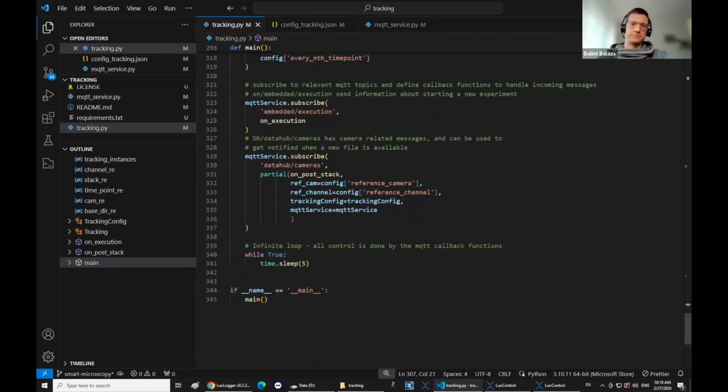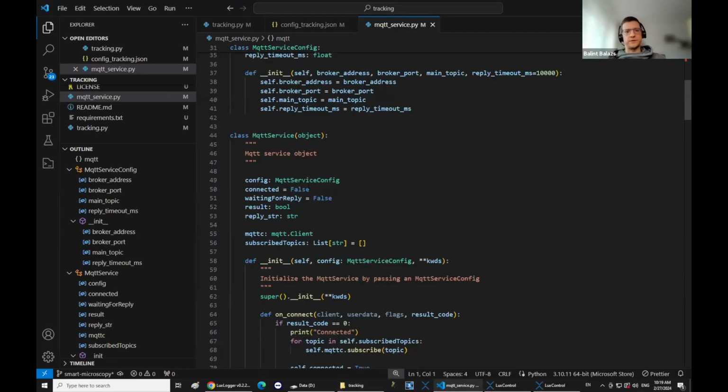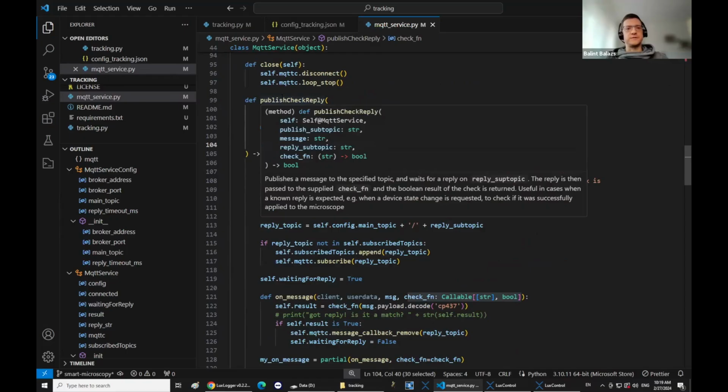And then sorry, but in a nutshell, that is just like a translator, right? Yeah, I mean, basically what it does is, because mostly this is asynchronous, right? So you send a message and then you don't know when the reply comes. And then what this service does, it gives you some helper functions to synchronize this. So if you expect the reply, then it has, for example, this method called publish check reply, and then you can define which topic to publish to, what's your message, where do you expect the reply to come, and then you can provide the callback function to check this reply.